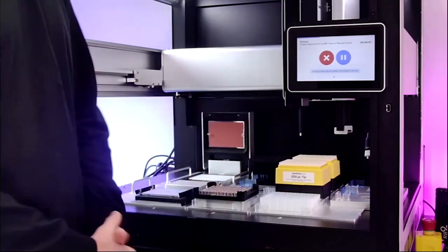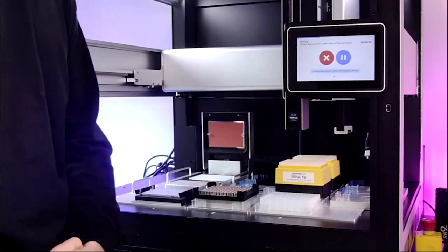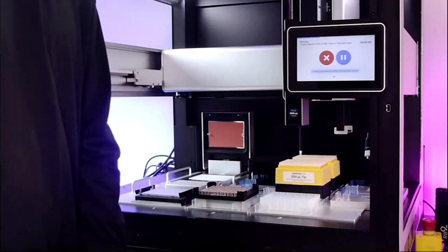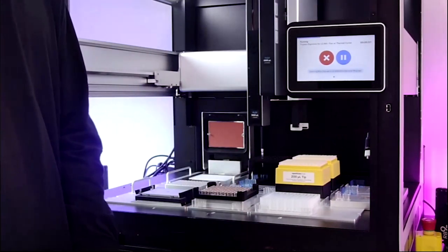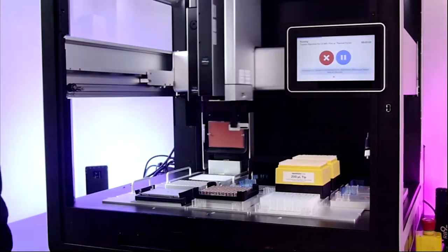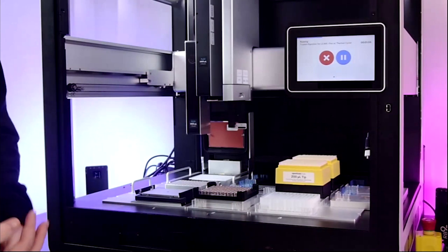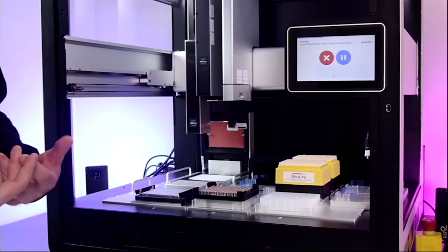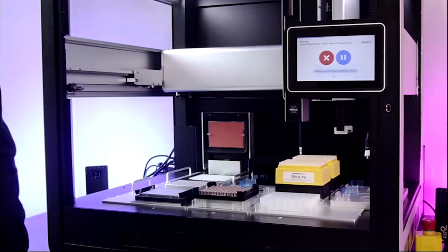As you can also maybe tell, there are just kind of short descriptions of each step that are going to populate in. This is another really helpful feature of protocols that have been downloaded from the protocol library, is that these are written out in the Python script as commented out lines. And so it's really very nice to see what these relevant steps look like in a robustly designed protocol.